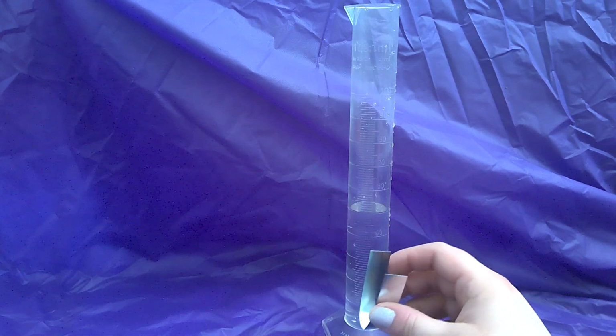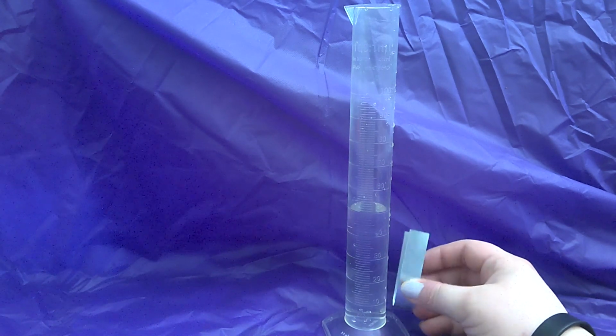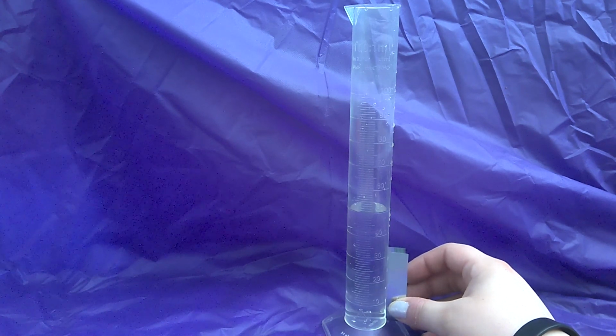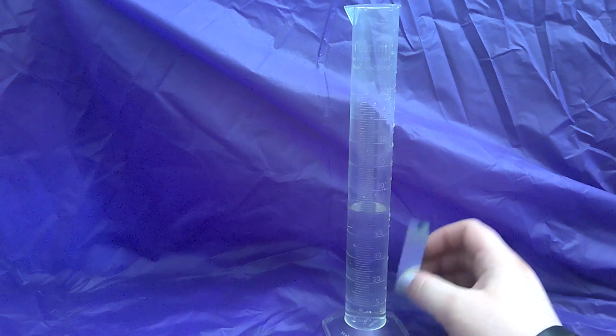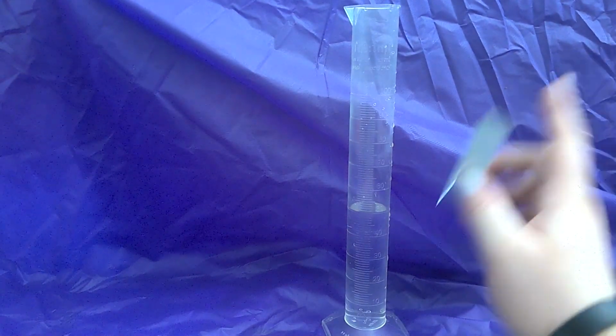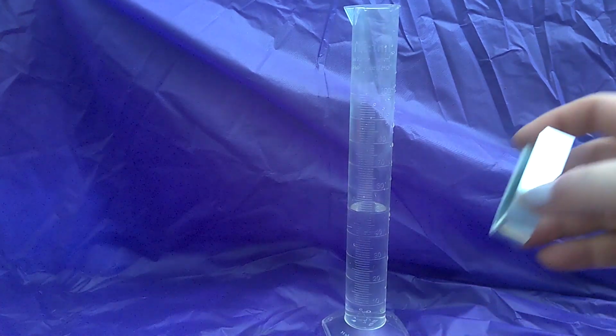So I originally started off with 50 milliliters. Before adding water, what I always suggest is take your graduated cylinder, take your object, and put it towards the bottom and see how tall your object is. You want to have enough volume to cover your object, so you can see that definite rise in the volume. That's where the 50 came from, and that's what we wrote on the whiteboard at the very beginning. Okay, now I'm going to add my object.